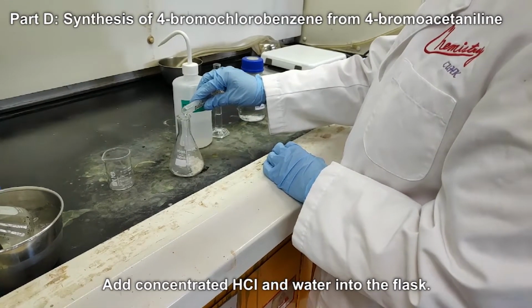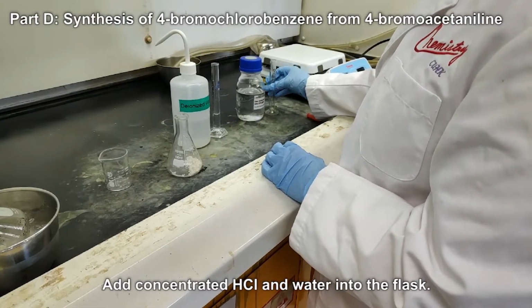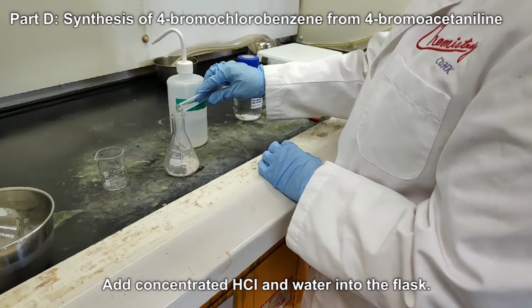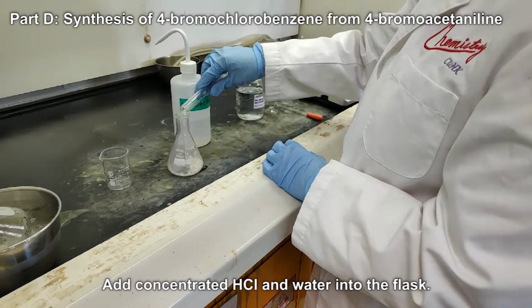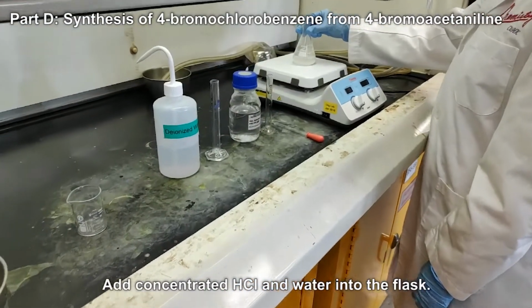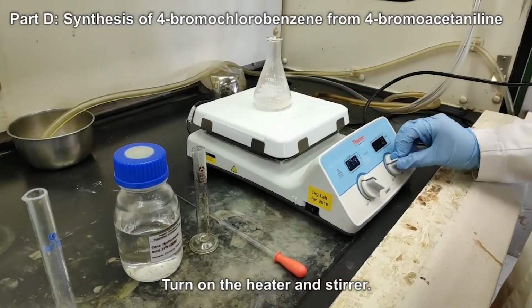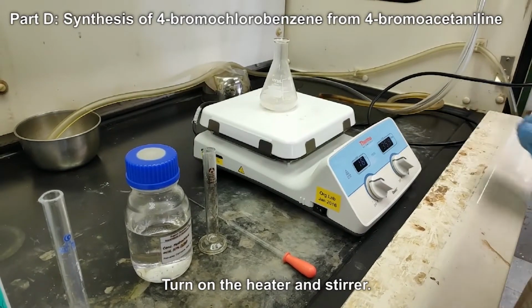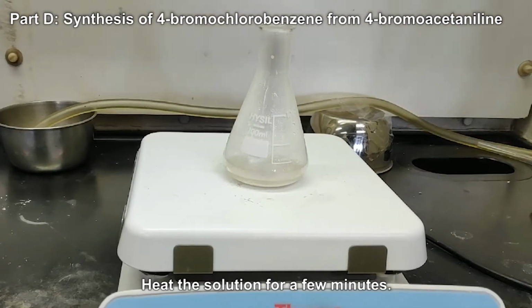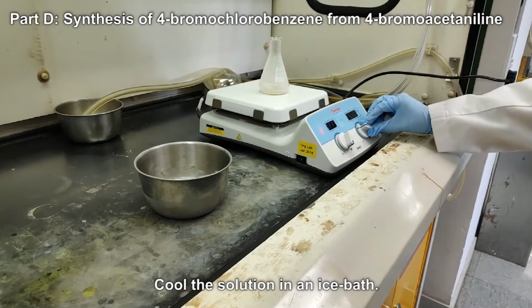Add concentrated hydrochloric acid and water into the E-flask. Turn on the heater and stirrer. Heat the solution for a few minutes. Cool the solution in an ice bath.